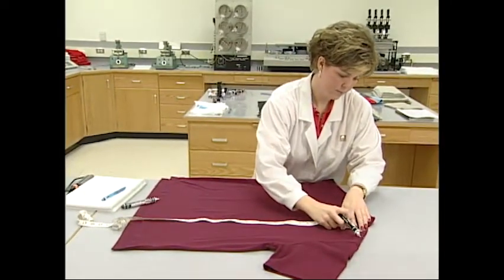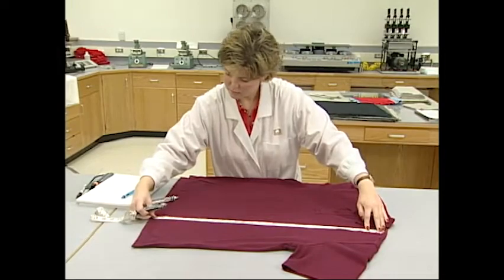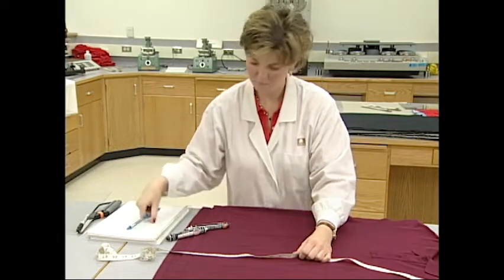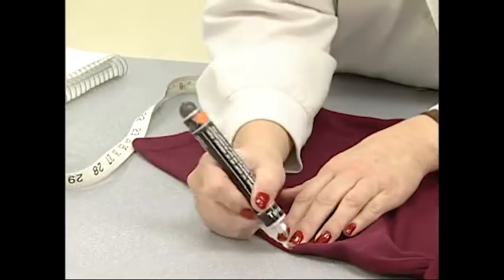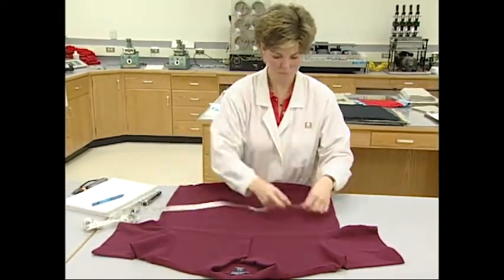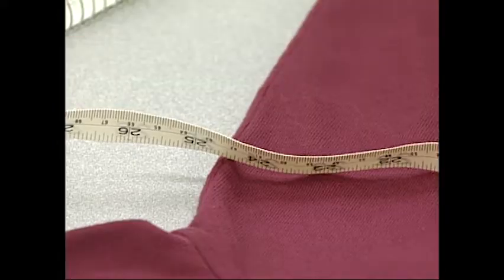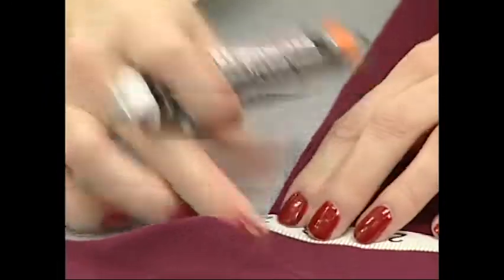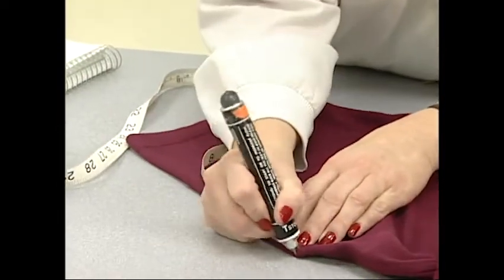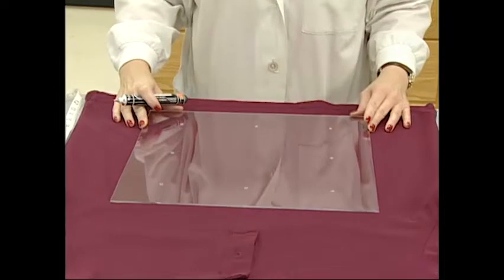The benchmark for length shrinkage is determined by measuring from where the collar is sewn into the shirt at the junction of the shoulder seam. A mark is made at this point and a tape measure is stretched from this point directly down to the bottom edge of the waist hem, where the length is recorded to the tenth of an inch. The width is measured on the front of the garment just under the armholes, one inch below the point where the sleeves are sewn into the garment, measured in tenths of an inch from one side to the other. The sleeves are also measured for length and width.